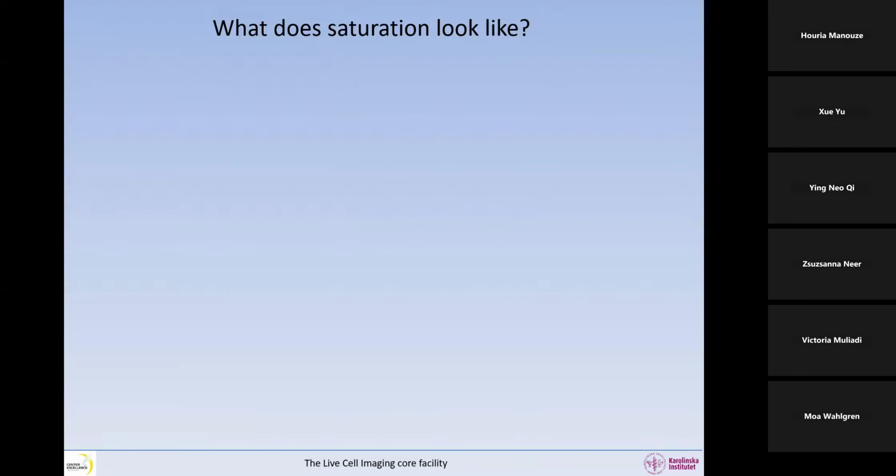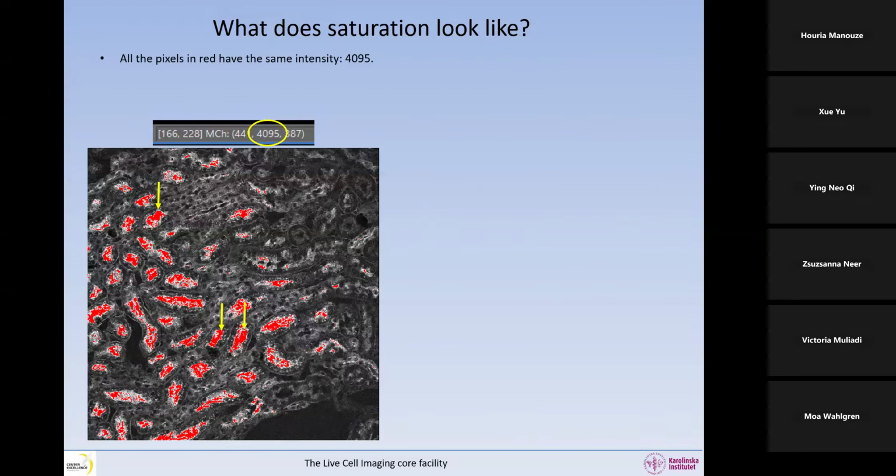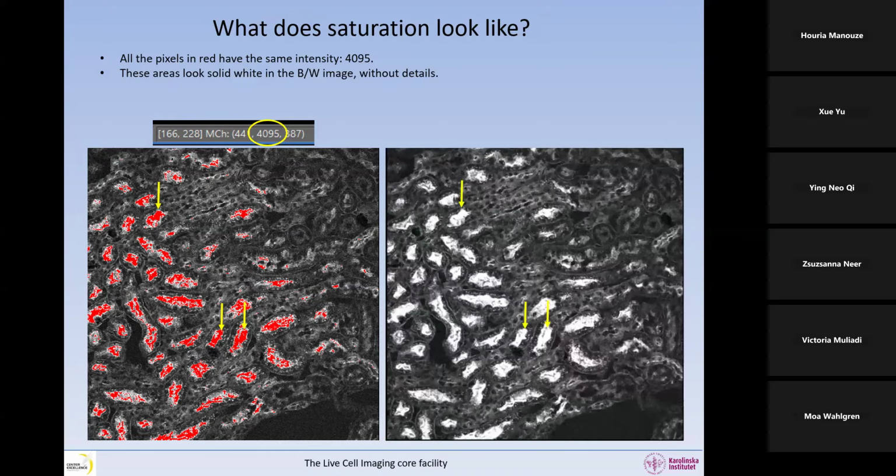So what does saturation look like? This is an enlarged image of this. All the pixels in red have the same intensity, 4095. If we remove the color mask, it's a little bit harder to see, but it is possible once you have a trained eye to realize that all these pixels are like a big white. There's no detail at all. So all these areas look solid white in the black and white image. There is no detail, and so this is an artifact called saturation.